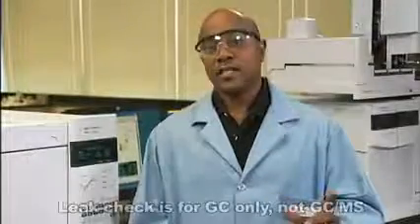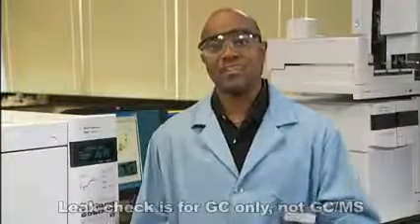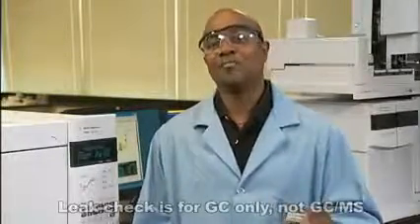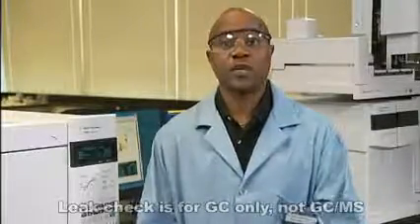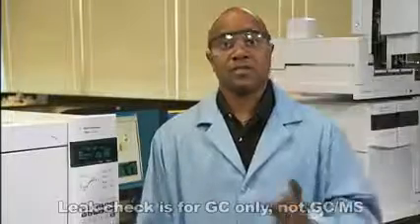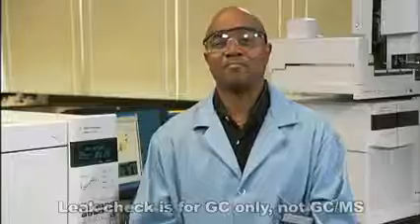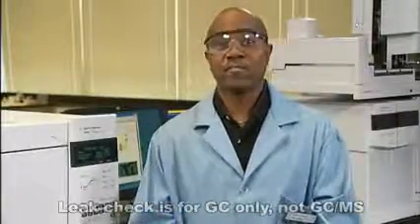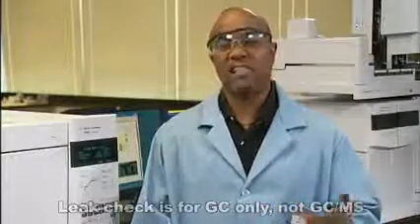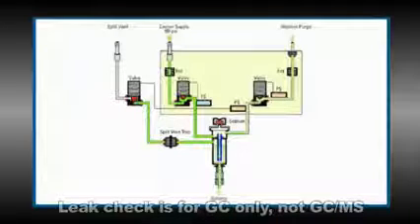I'm going to walk you through a simple inlet leak check. It can help you catch a leak from a loose fitting or bad seal, things that happen when you install a column or replace a liner, or after the first few temperature cycles of the oven. There are 3 things I like about this test. It doesn't take much time. Also, it uses the GC flow sensor to measure the leaks, and you get feedback when you find and fix the leak. Here's a sketch of the leaks it should help you find.